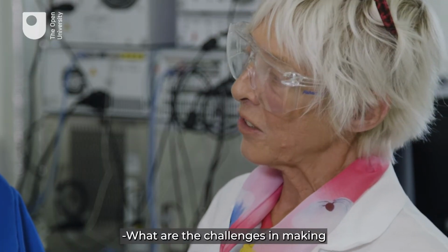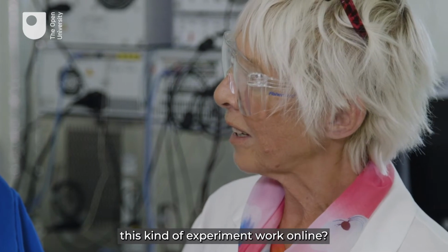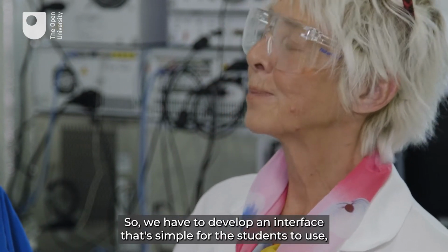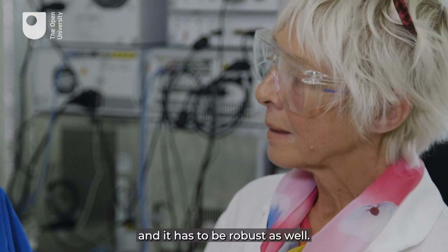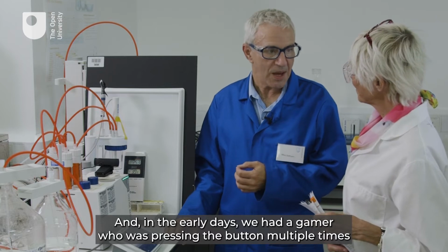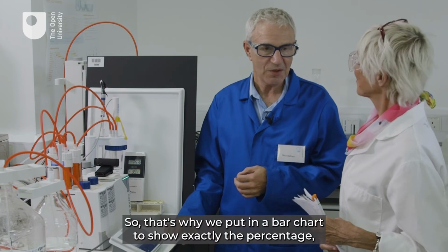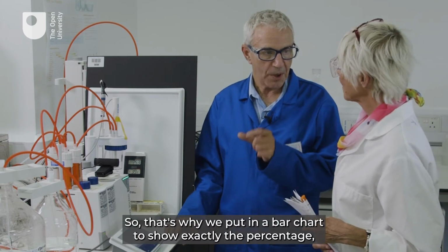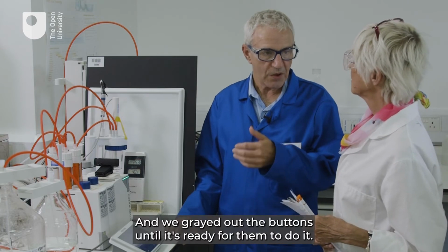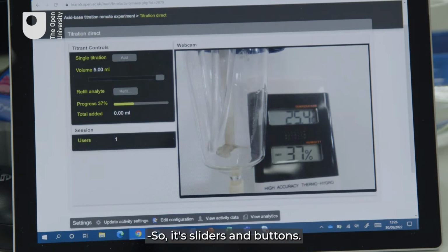What are the challenges in making this kind of experiment work online? So we have to develop an interface that's simple for the student to use, and it has to be robust as well. In the early days, we had a gamer who was pressing the button multiple times with no patience. So that's why we put in a bar chart to show exactly the percentage, how it's gone, and we grey out the buttons until it's ready for them to do it. So it's sliders and buttons, basically.